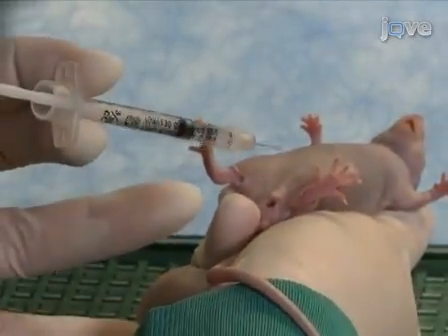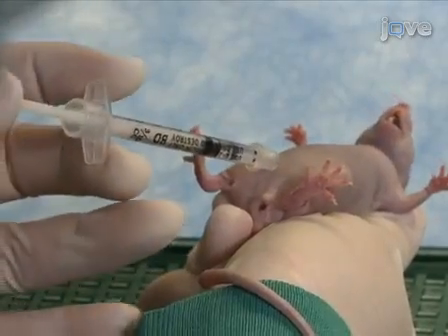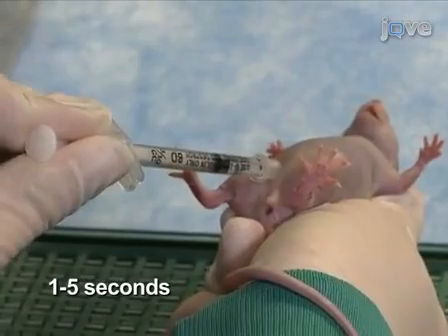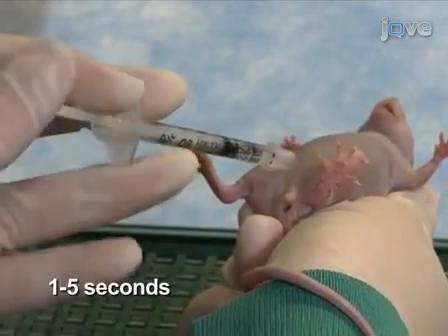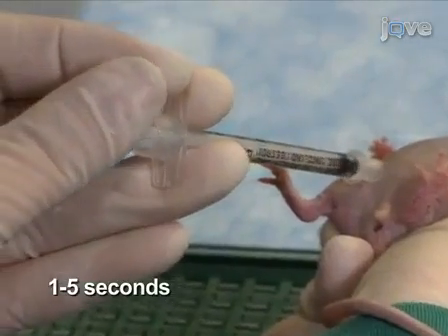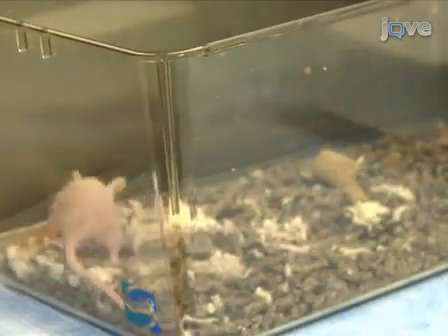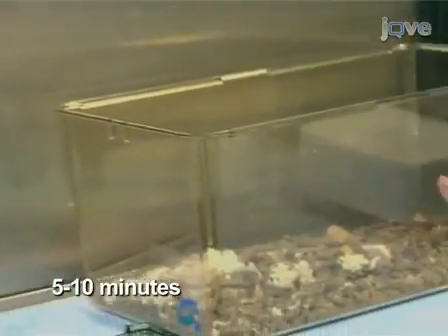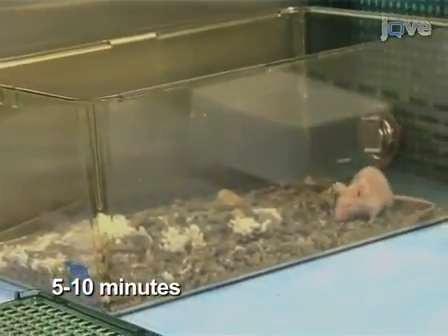To ensure that the needle is in the intraperitoneal space, pull back on the syringe plunger. If no fluid is aspirated into the syringe, then inject the syringe contents with an even pressure over 1 to 5 seconds. Release the mouse. Monitor the mouse for 5 to 10 minutes after the injection to ensure that it returns to normal activity levels.